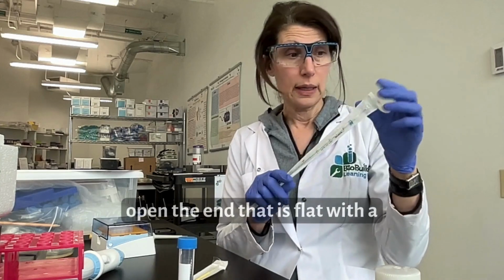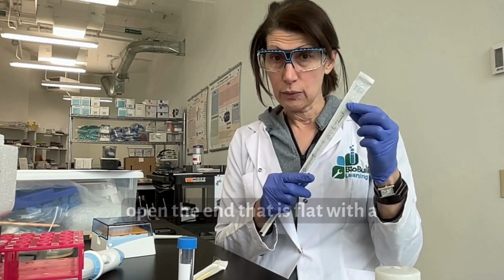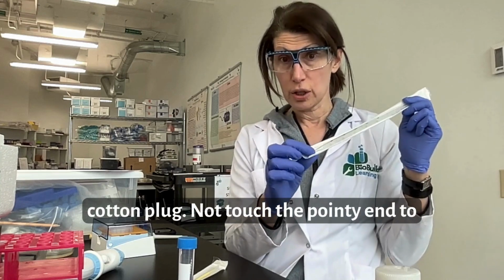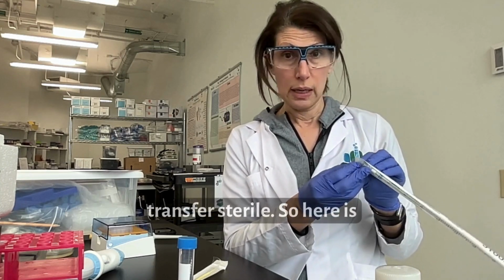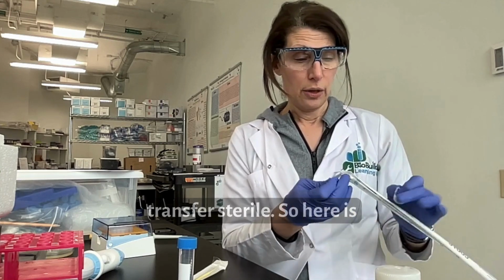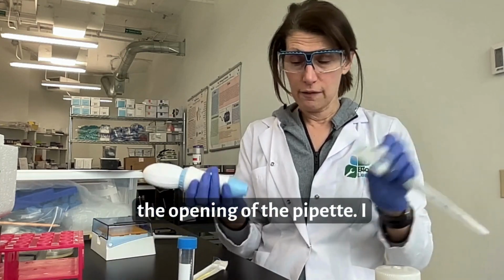Again, I'm going to open the end that is flat with the cotton plug, not touch the pointy end to anything except the materials that I want to transfer sterilely. So here is the opening of the pipette.